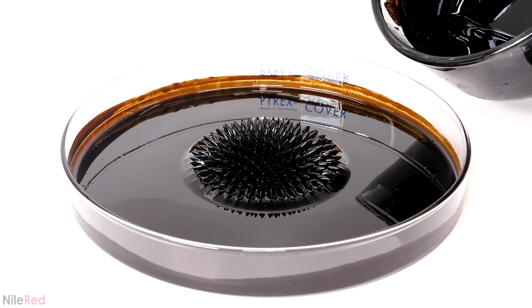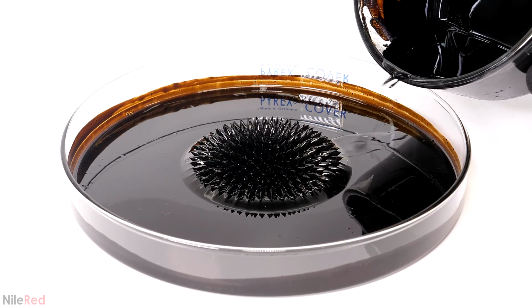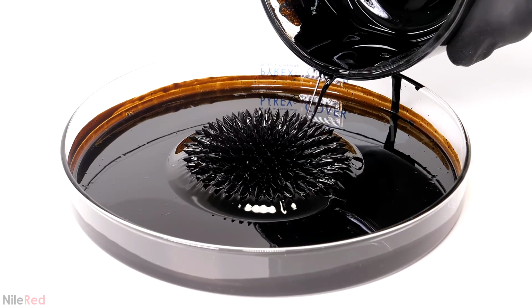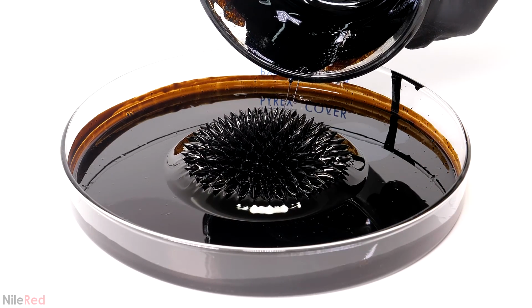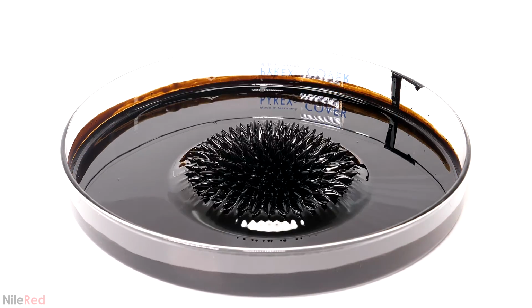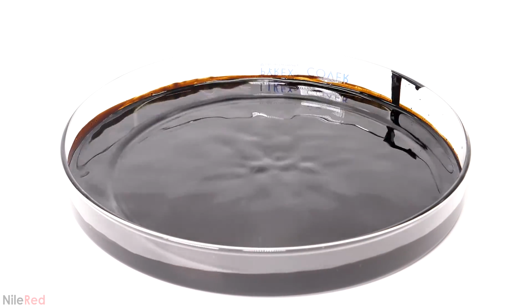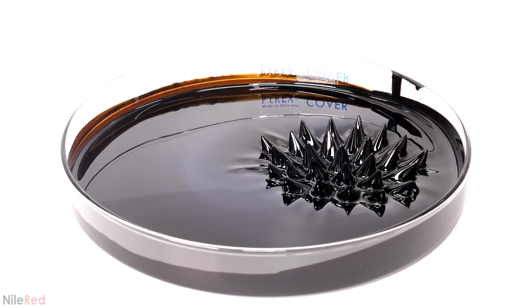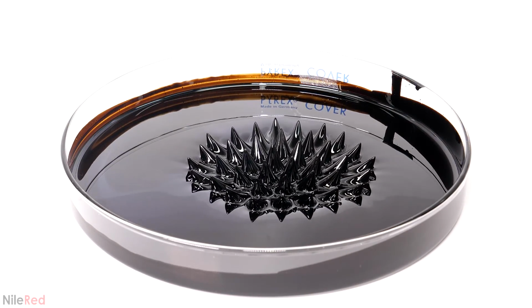What I had here was still only half the batch, so I went ahead and mixed the other part with kerosene, and I poured it all in. All of the fluid seemed to overload the magnet, though, so I decided to try it with a much larger one that I just got that morning. It seemed to be able to handle this much fluid a lot better, and the spikes were also bigger.